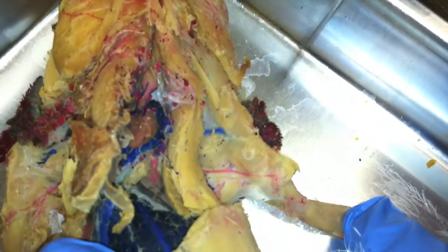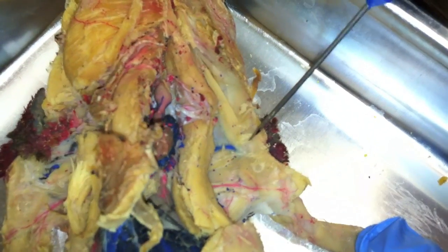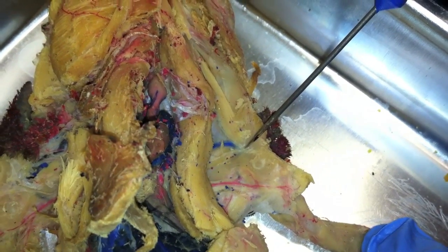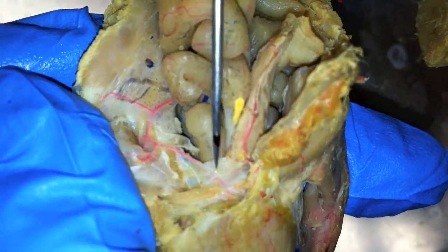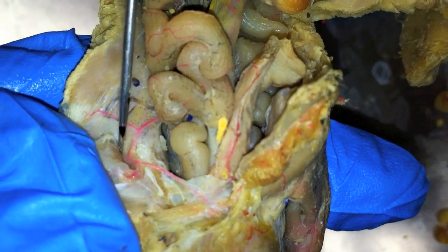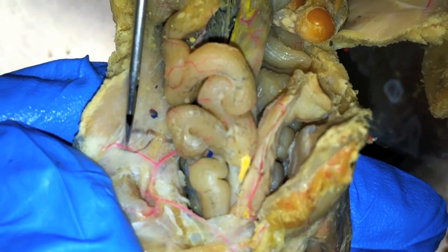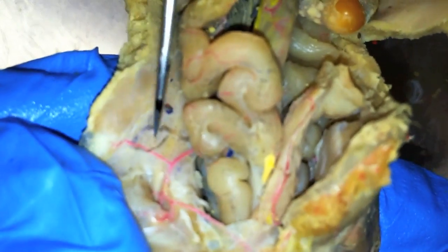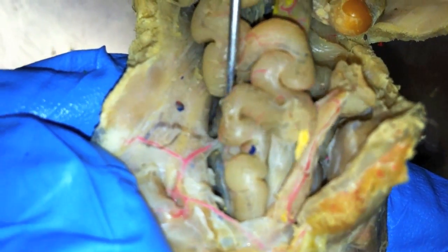We're looking for the subclavian vein. We have the subclavian — subclavian artery — which continues into the arm, and it's the subclavian vein. Starting here is your hypogastric, going down to your femoral, which you don't need to know, but it continues to the epigastric going up, and then going further into the body is the iliac.